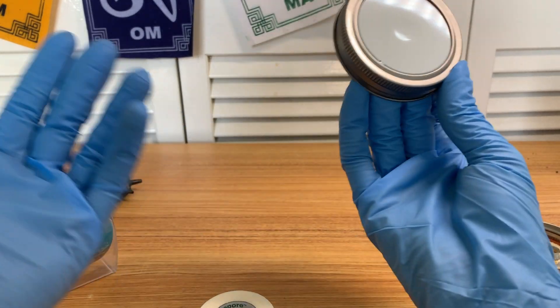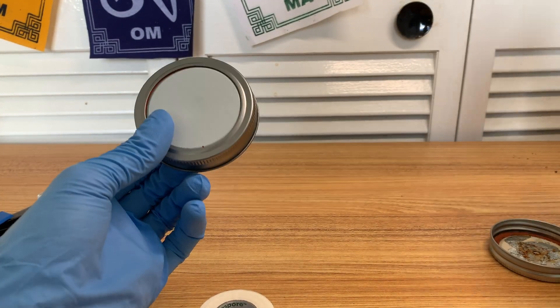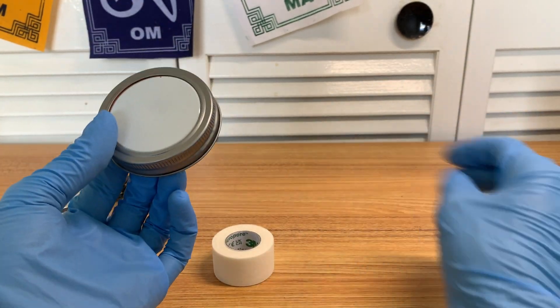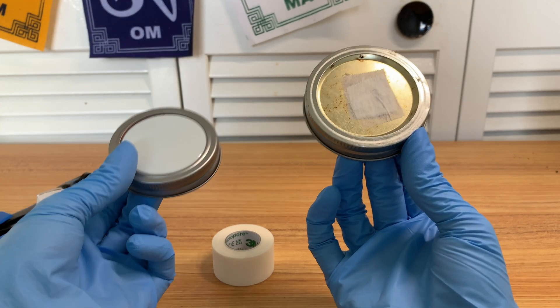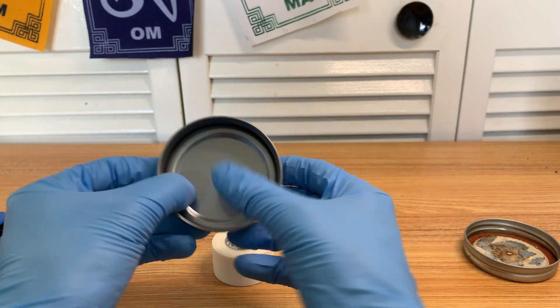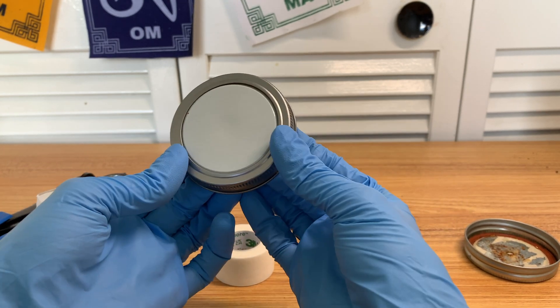For every other method — which is the majority — when I'm going from agar plates, I'll go unmodified. Simply because it's not a performance thing; I don't find any difference in performance or increased contamination between the two. Also, it's nice to have lids without holes — just a little more incognito and cleaner to have around the house.